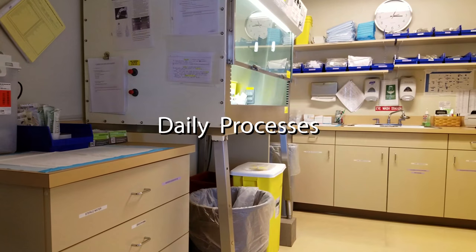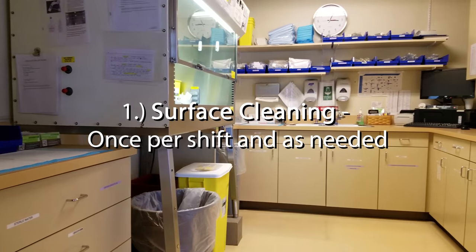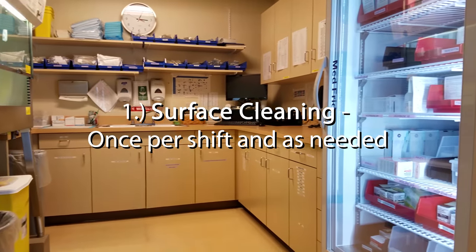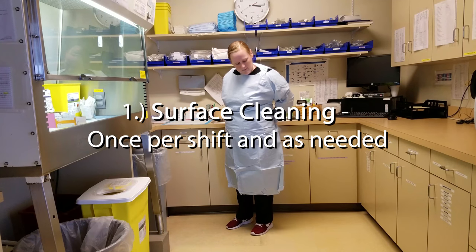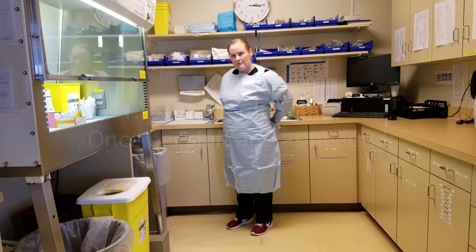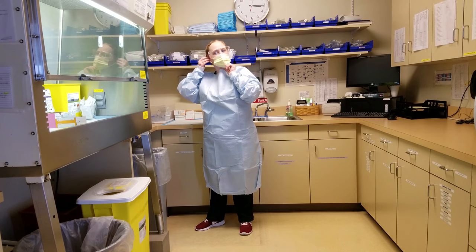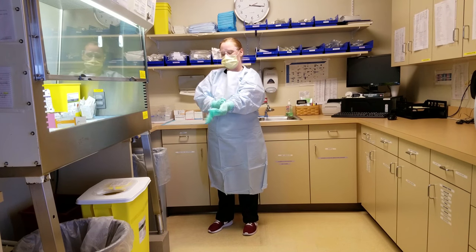Daily surface cleaning. Every day, mix room counter surfaces should be cleaned at least once and as needed during the shift. Staff should first don appropriate PPE.